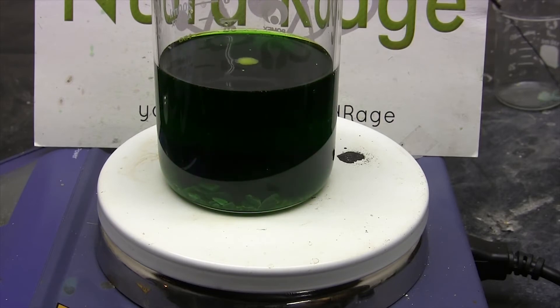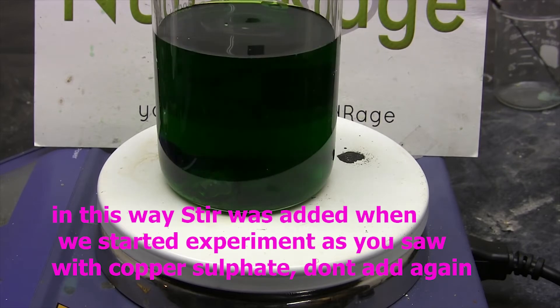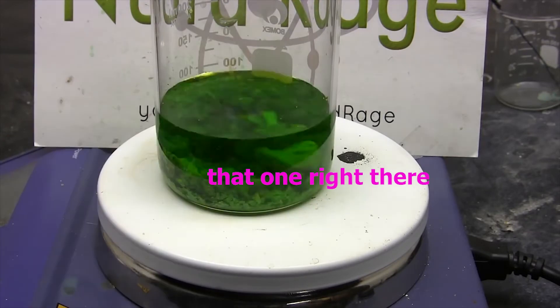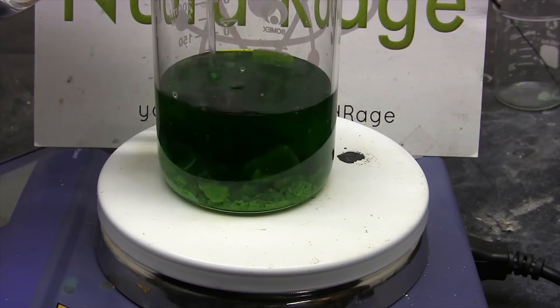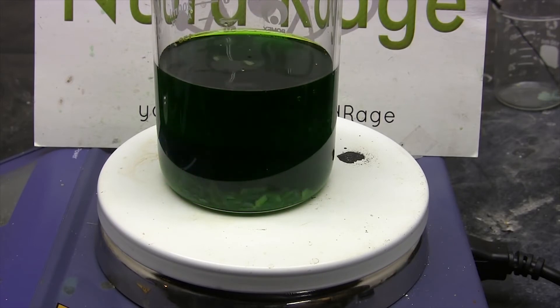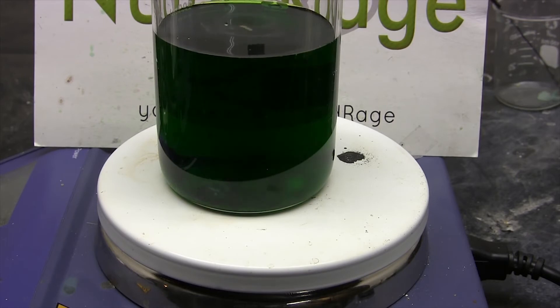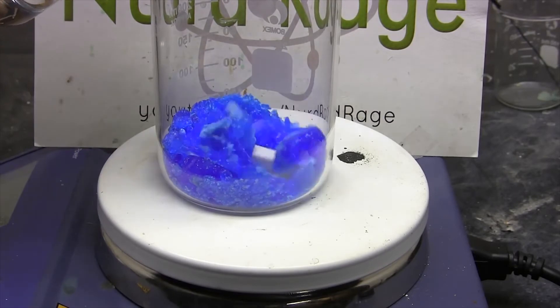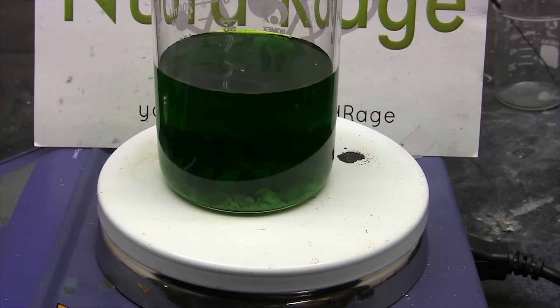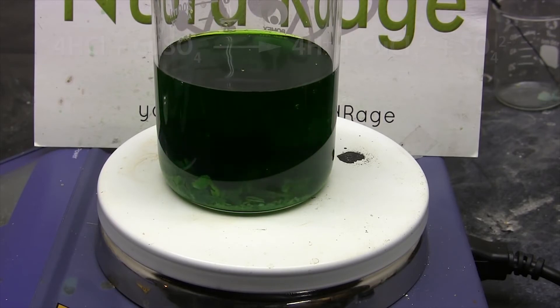Make sure you add a stirrer. If you don't have a stirrer, use any apparatus that can help you stir it. When you add the stirrer, stir until all the copper sulfate — which should look like a purple-blue color — disappears. Once it dissolves, which should just take a few minutes, it will form copper chloride.